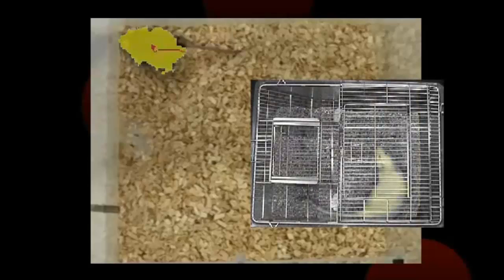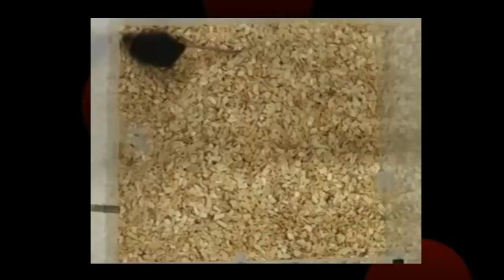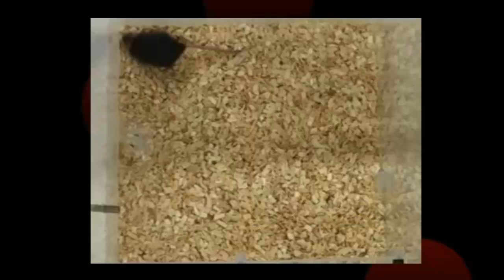For example, that might occur because of obstructing bars on a home cage, or when the animal has varying or little contrast with the background. In such a situation, use activity analysis instead.